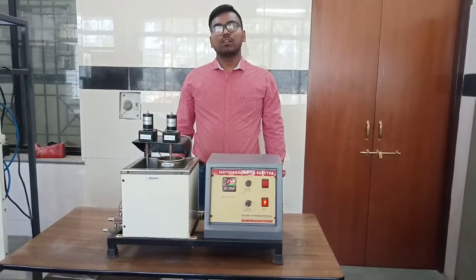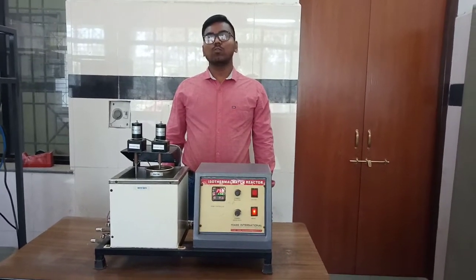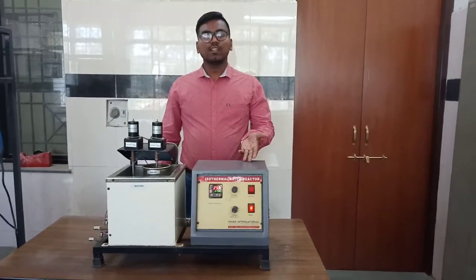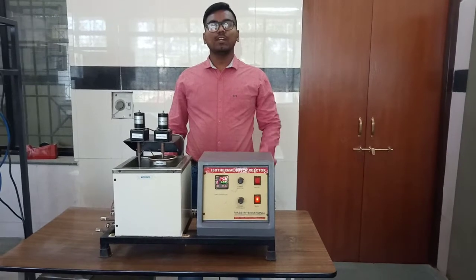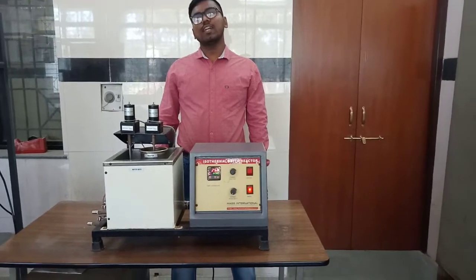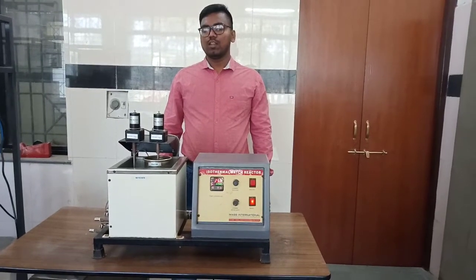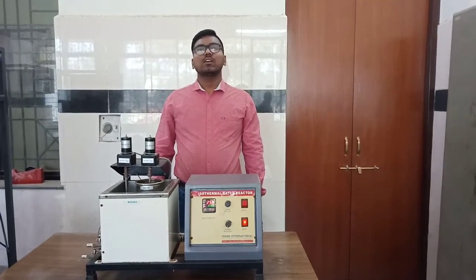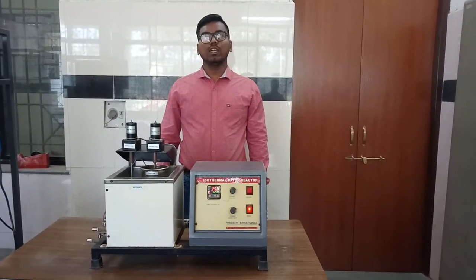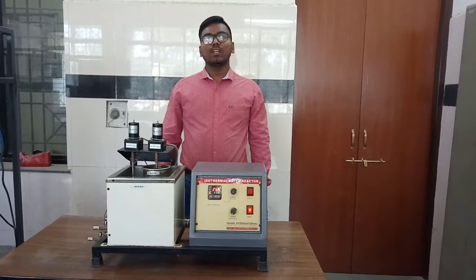We have taken the 0.1 normal NaOH solution and 0.1 normal ethyl acetate solution and poured both solutions into this batch reactor and set the temperature at a certain temperature, say for example 50 degrees Celsius, and we immediately take 10 ml of sample solution and titrate this sample against the 0.02 normal HCl solution, and repeat this procedure again after 2 minutes, and such readings will be continued for 10 or 20 minutes. So we will have 10 to 15 readings at one temperature.